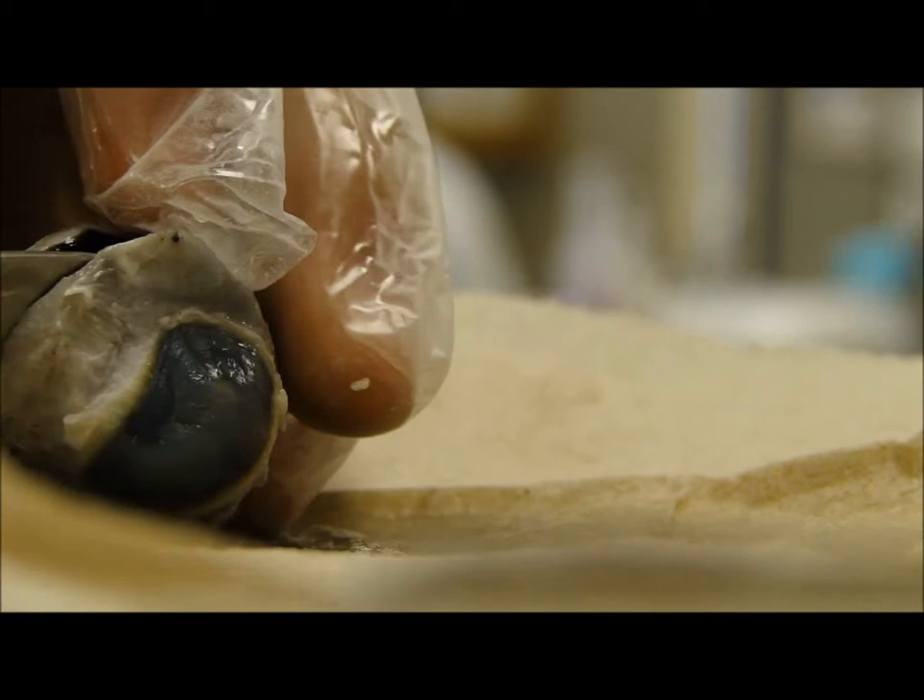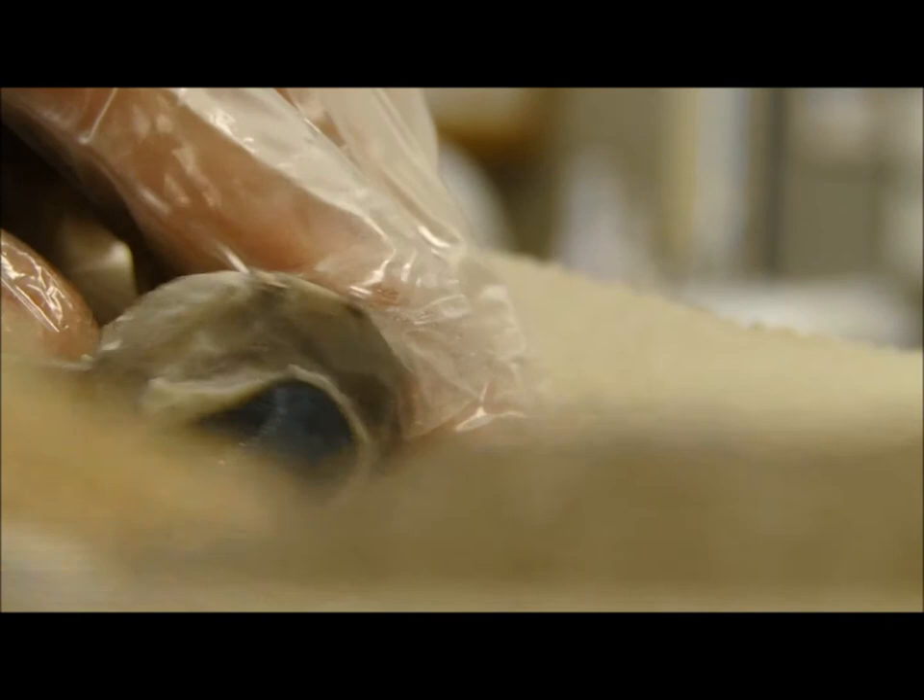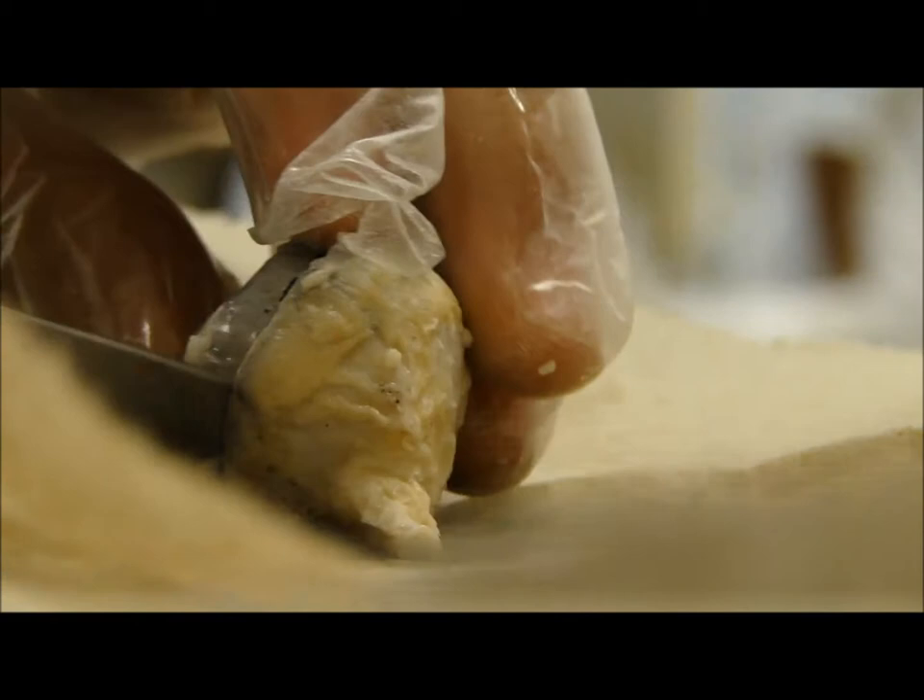You're supposed to cut it into halves. The whole thing in half? Yeah, the whole thing in half. Not the inside in half? Just the outer layer in half? Yeah. Well, it's okay if the thing slides out.